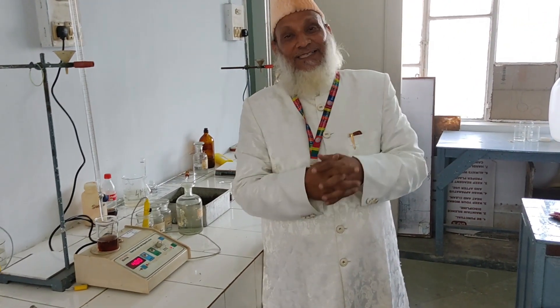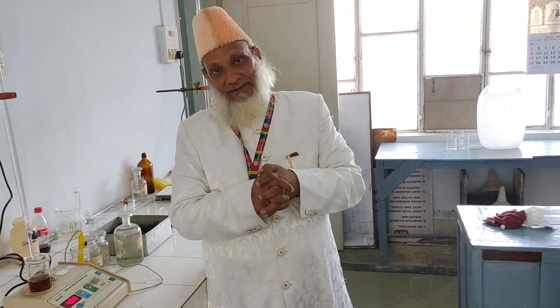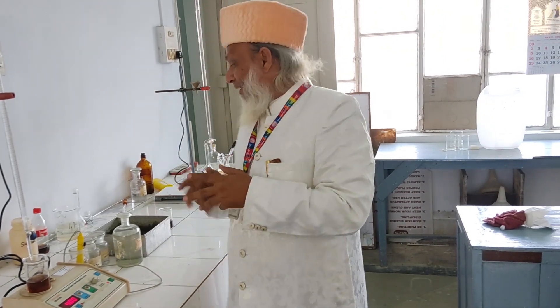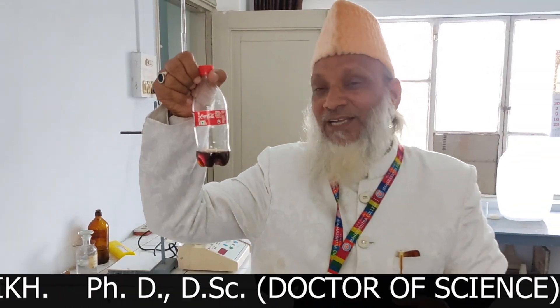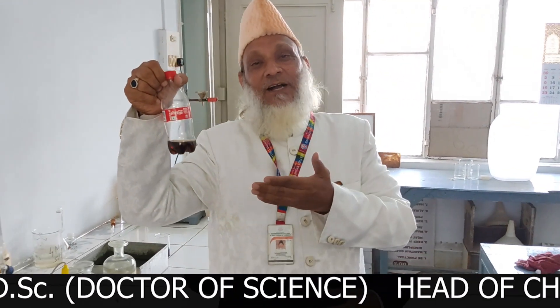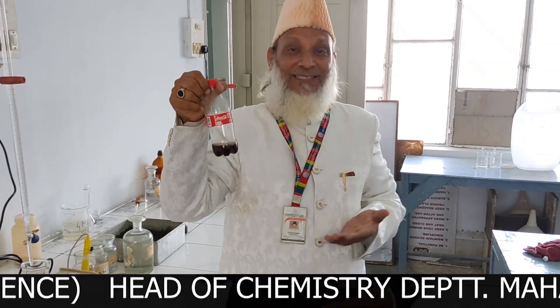Today I will demonstrate how to find out the amount of phosphoric acid in the given cola sample. Remember, in this cola sample, it is a carbonated drink, so there is carbonic acid H2CO3 also.